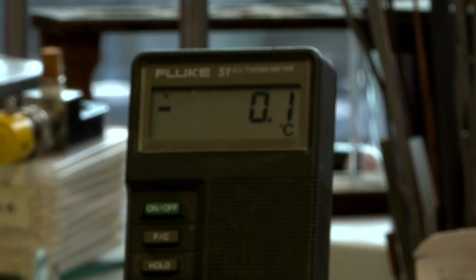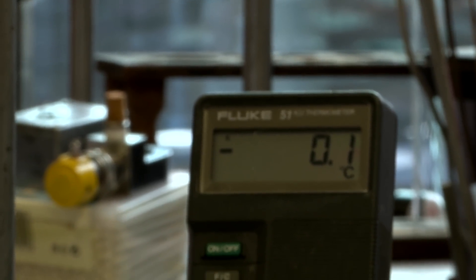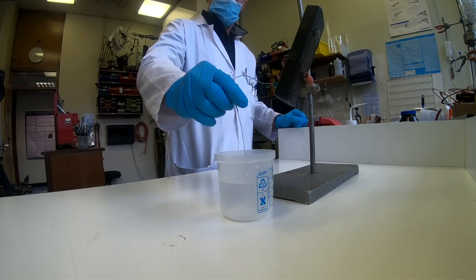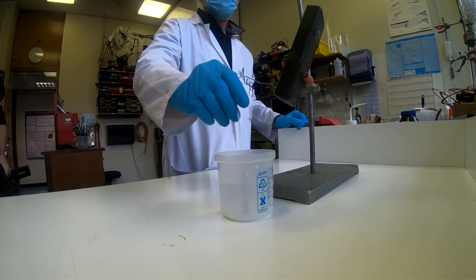So in the experiment you can see the temperature going down. It goes below zero centigrade, zero Celsius, the freezing point of water. Though of course there's so much ammonium chloride in the water by that stage that it wouldn't freeze at that temperature anyway.